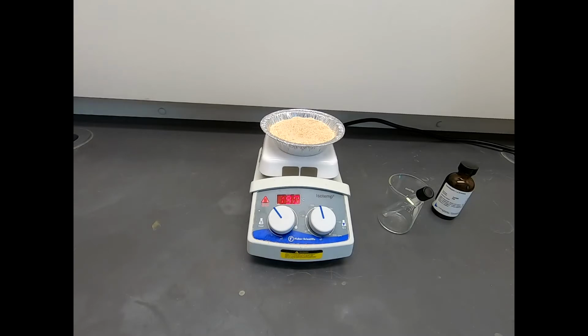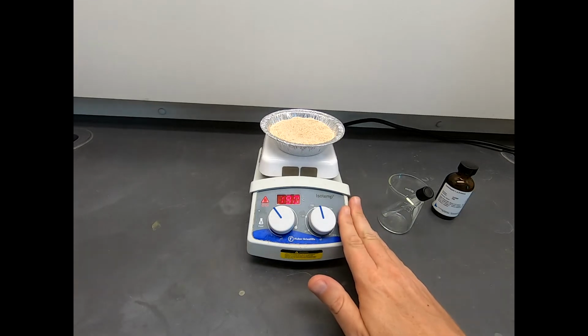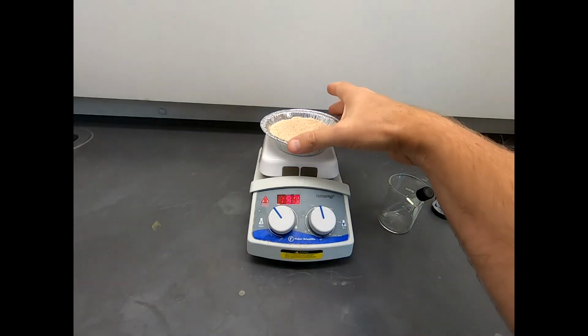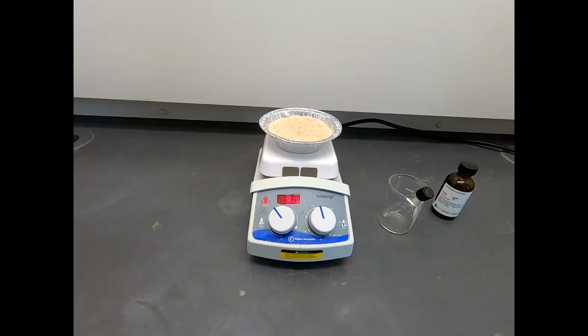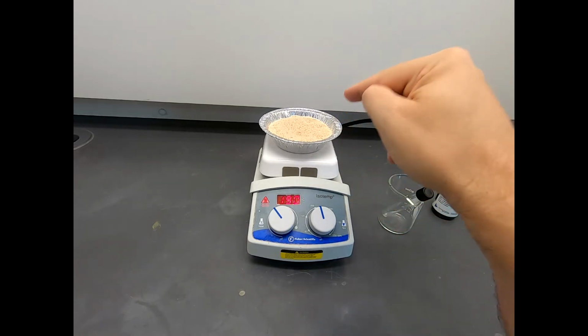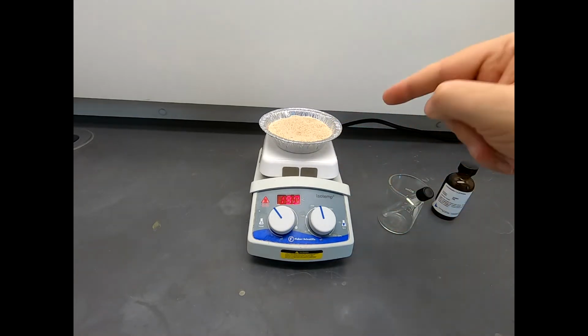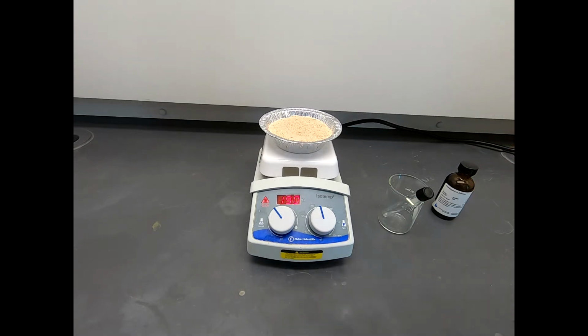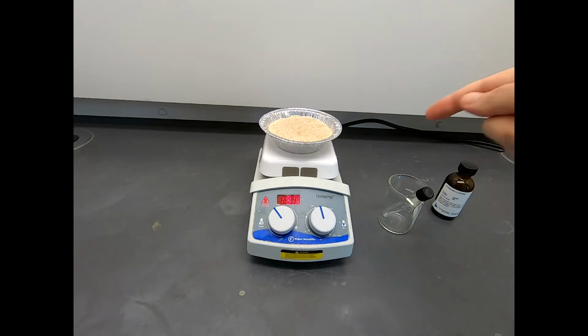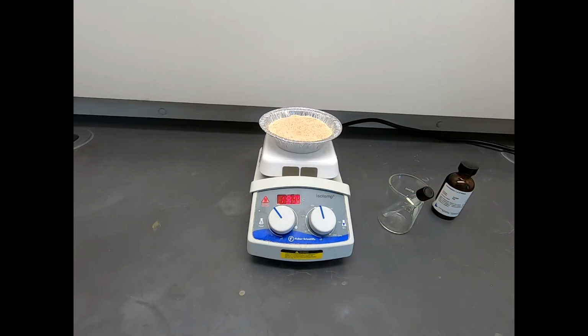Alright, in the hood we have everything we need to run this reaction. We have our hot plate, and our hot plate is set for 190 degrees, and keep in mind 190 degrees would be pretty hot for this reaction, but that is the surface temperature of the hot plate. Our sand bath will not reach that temperature. Now I could stick a thermometer in here and check that, but typically if you need your sand bath to be a certain temperature, you're going to have your hot plate set higher. So we have this set to 190.